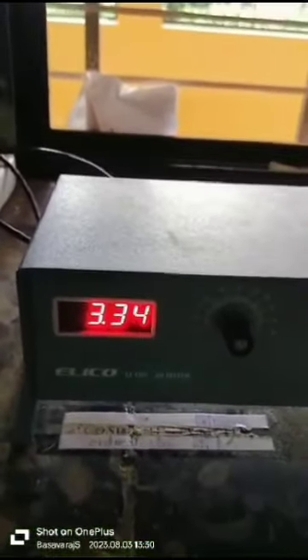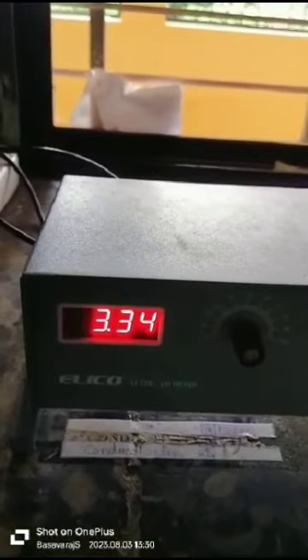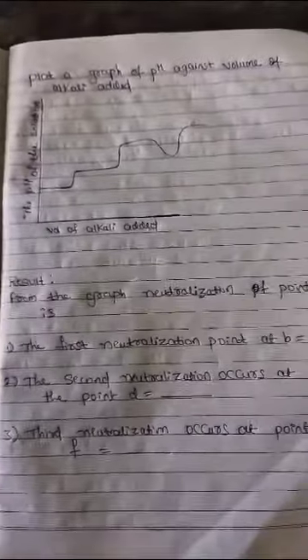Continuously add NaOH solution until the second neutralization point is obtained. Now take the reading. After the second neutralization point, add 30mL of 0.1N calcium chloride solution.